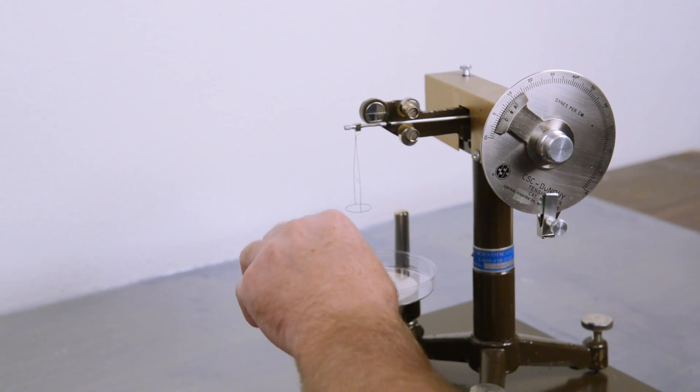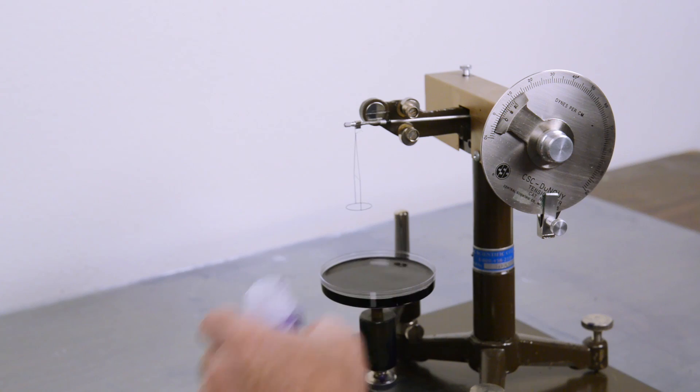Take the top off, pour it into just below the line. Put it aside, let's put the cap on.